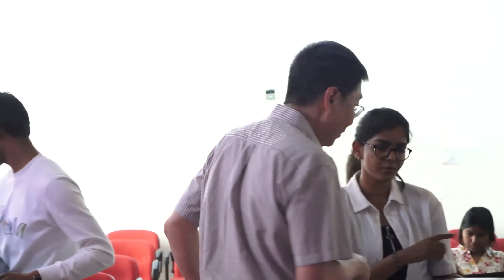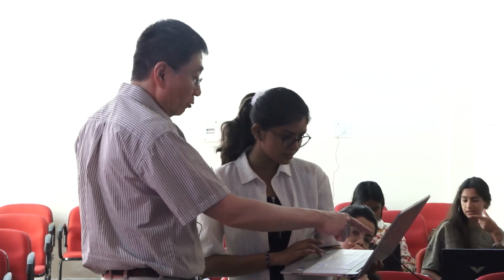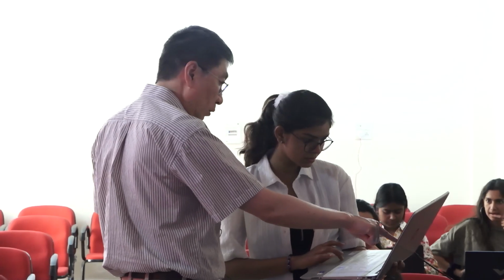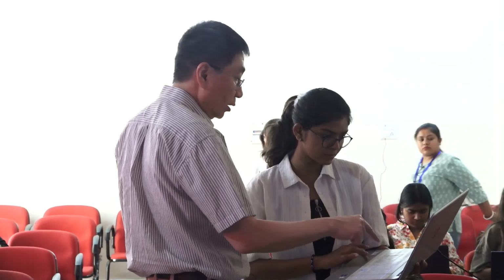After getting the sequence, what do we have to do? Click on the valine. So you're centered there. And you look around, you see the extra residue. Rotate around it. See, this is the lysine right here. Lysine residue. So you build, you add a terminal residue to it.